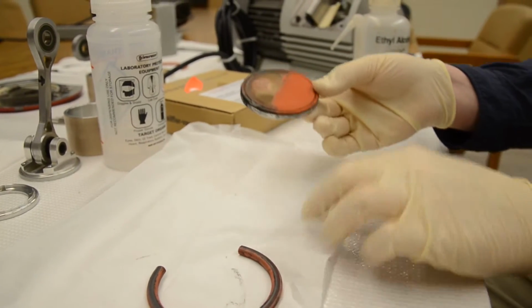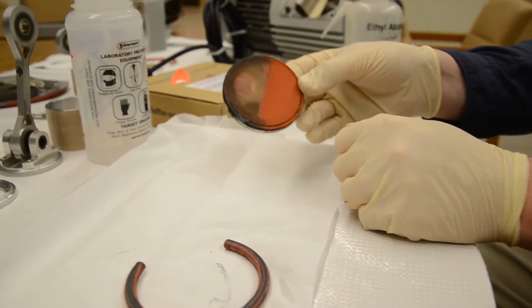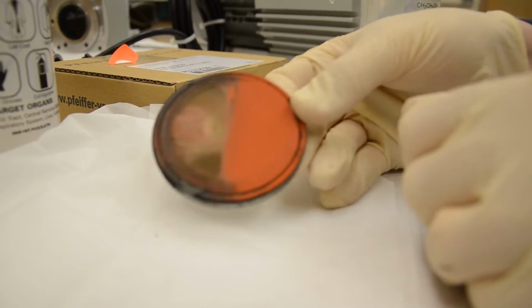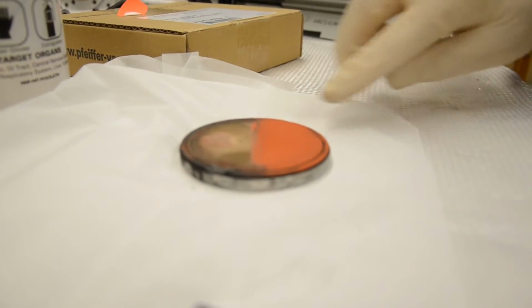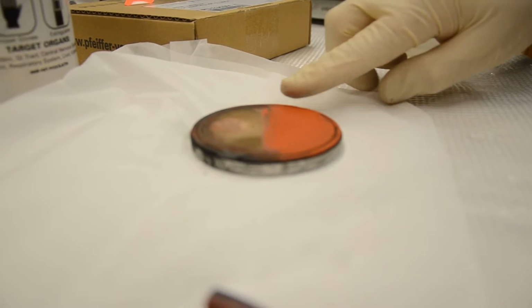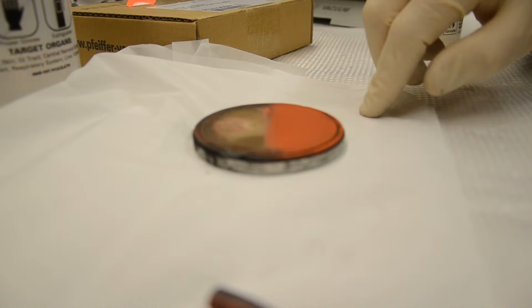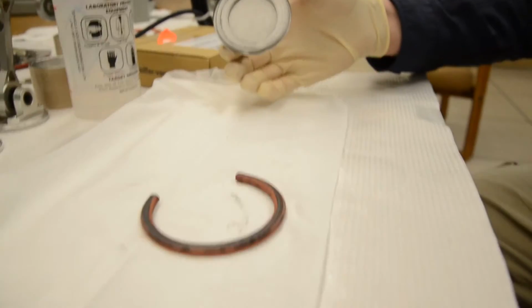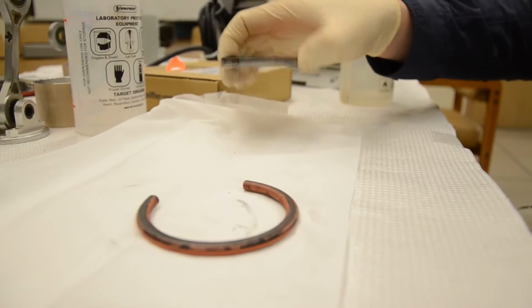And what we want to look at, and we cleaned half of it just to illustrate what it looks like. Now this valve is very worn. It's been used for a very long time. It's got some deep grooves in it, and there's also kind of a physical discontinuity around the sides. So we're actually going to go ahead and replace this piece. This is what the bottom looks like, being aluminum.